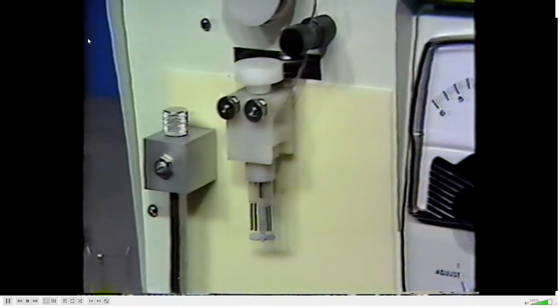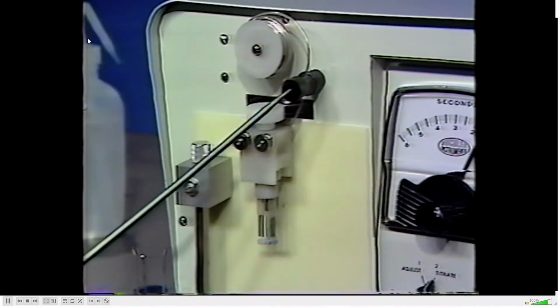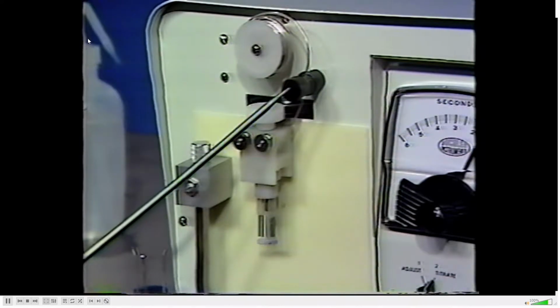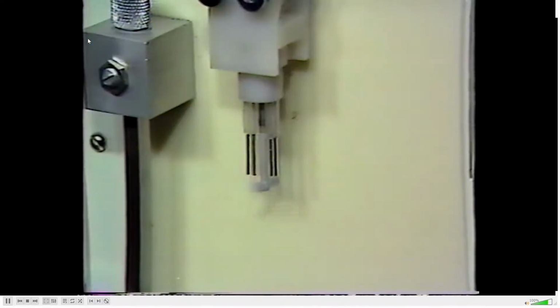Silver wire is fed into the adjustable terminal from an external supply that makes contact with the binding post electrical connection. The stir must move freely, and care should be exercised in making sure it does not brush against the generator wire.